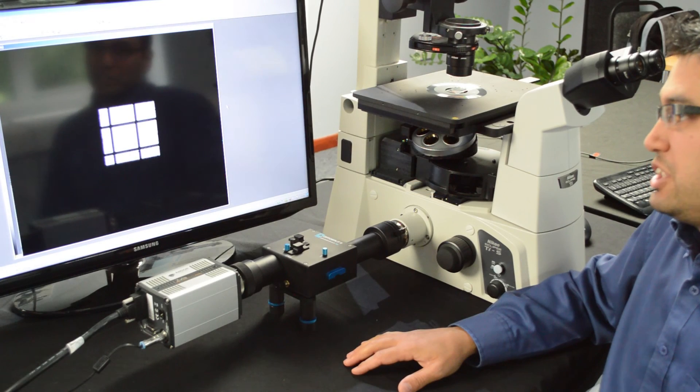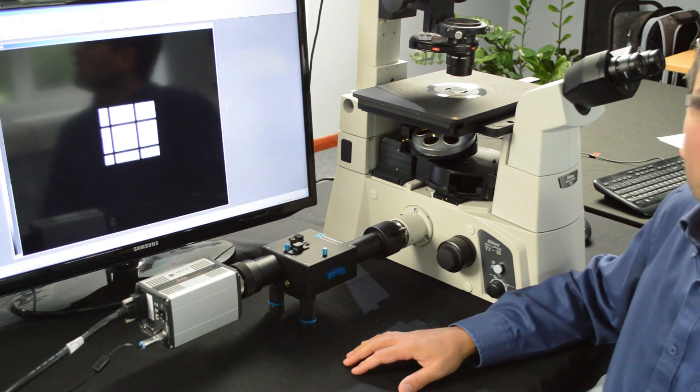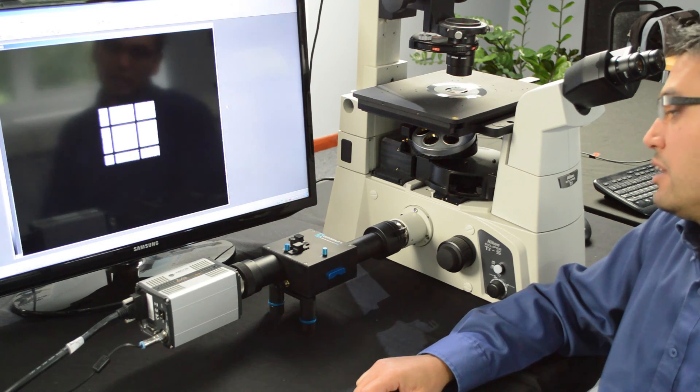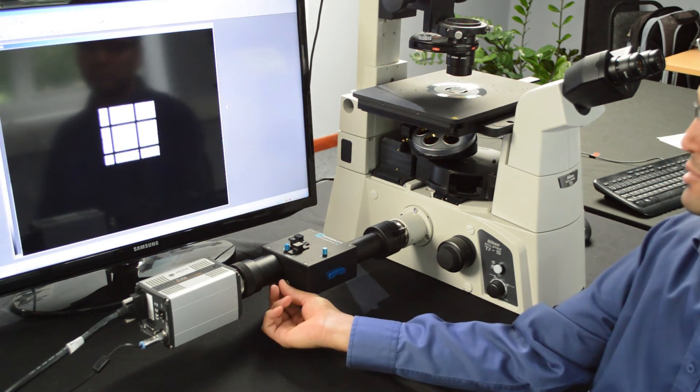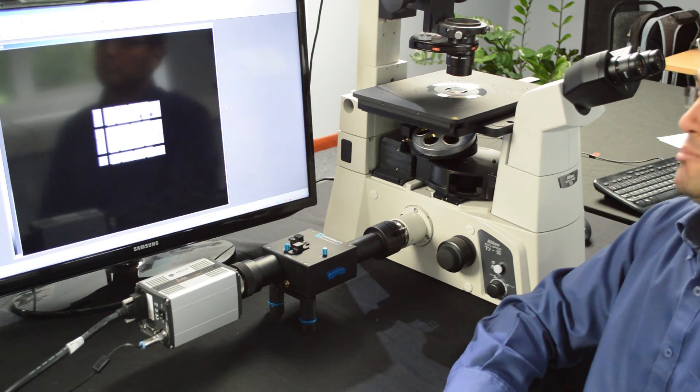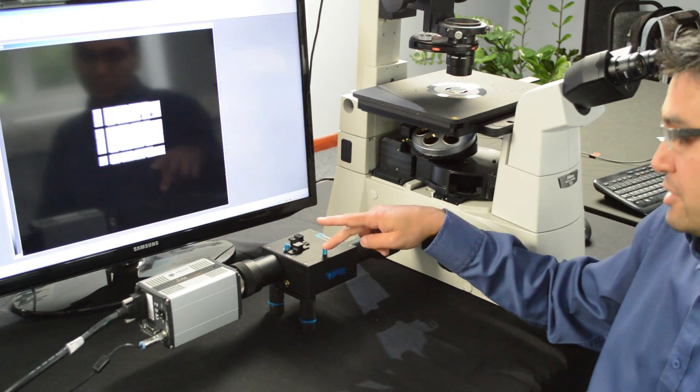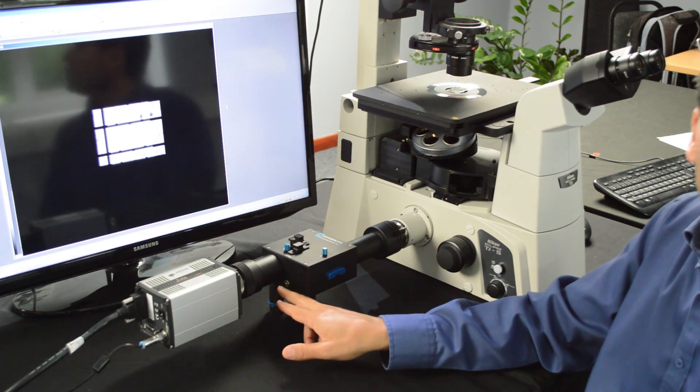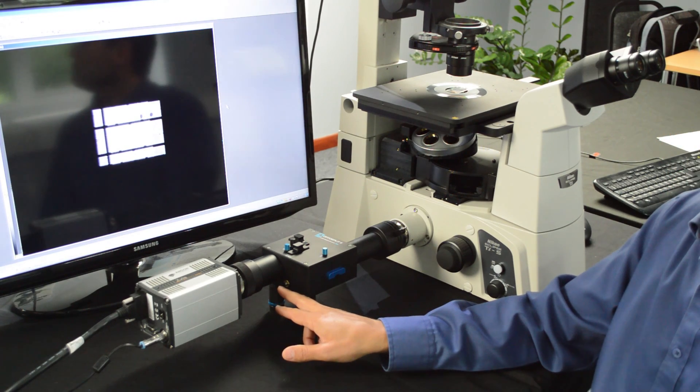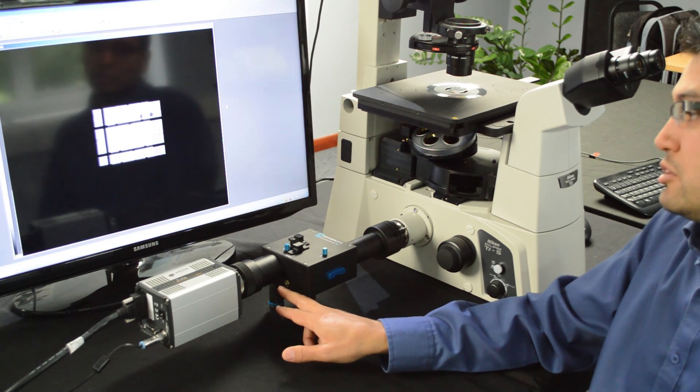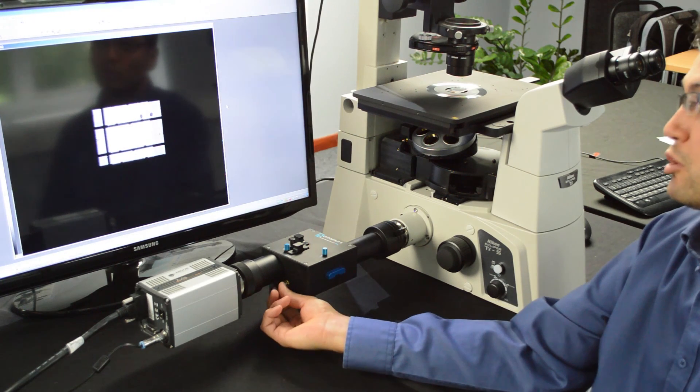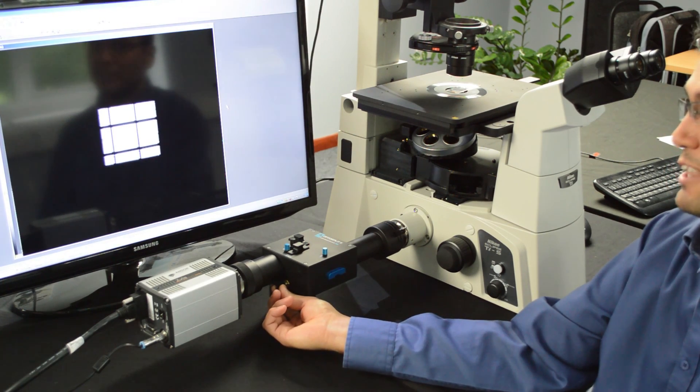What you want to achieve is to have both emissions overlapping in the same area of the chip and you do that by using your vertical alignment or V1 and your separation control. And one thing to bear in mind is that you always should use your separation control, rotating it anti-clockwise if you want to separate your emission wavelengths or clockwise if you want to bring them back together.